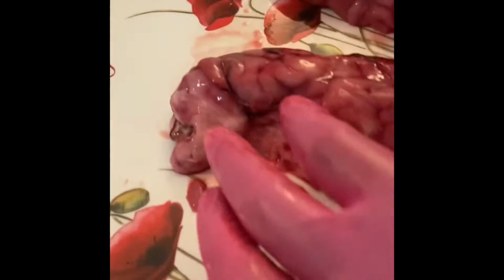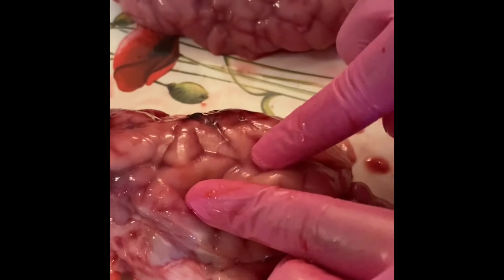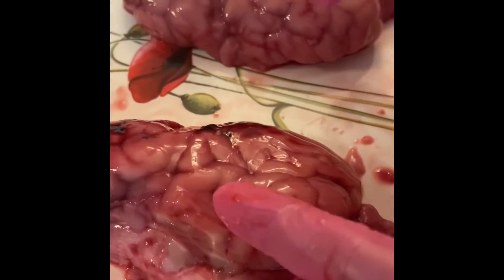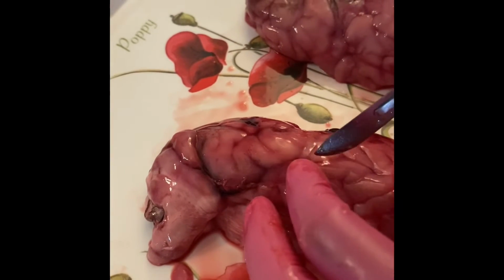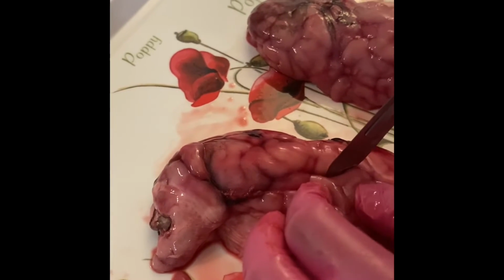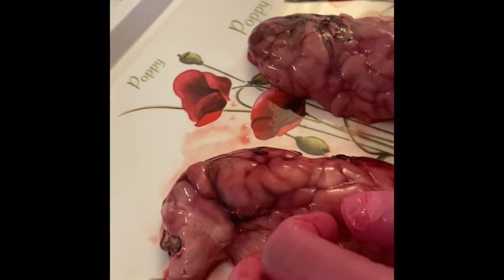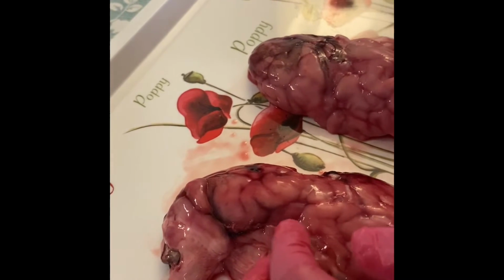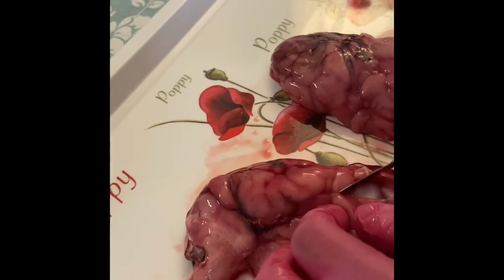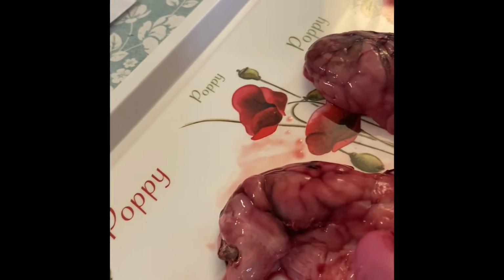Now let's see if we can. Do you see this membrane? There's a membrane here. Look, I can't see inside. You see, there's a very thin covering here. Let's see if we can cut the membrane. Let's see if we can remove the membrane. I'll do half of the brain, and then you both can do the other half. Look at that. You see the membrane coming off a little bit? The membrane is quite important, isn't it? Look at that. Now we can look inside the brain.